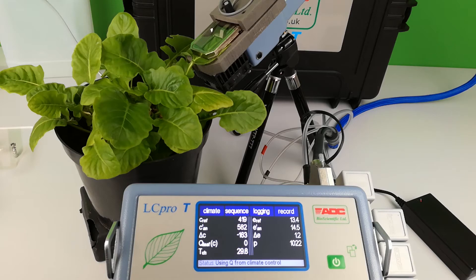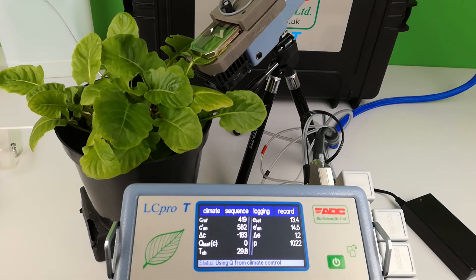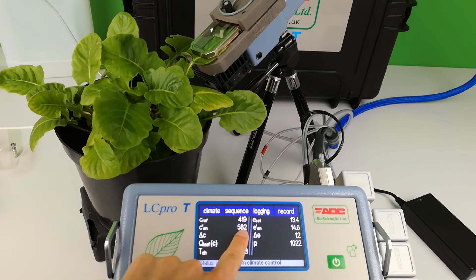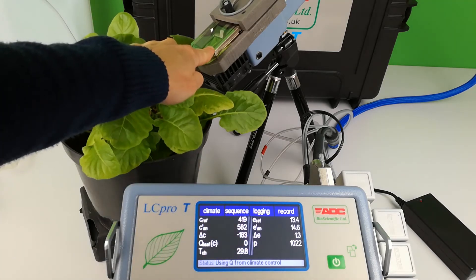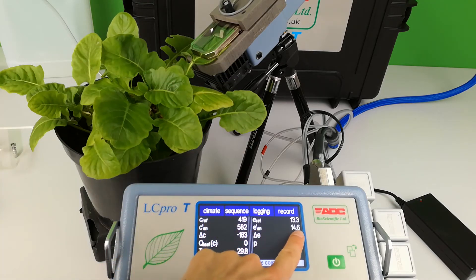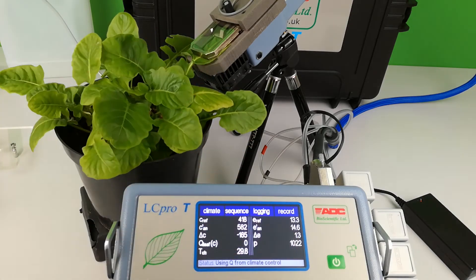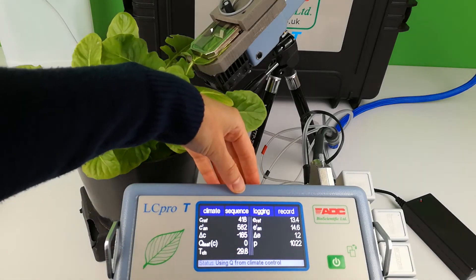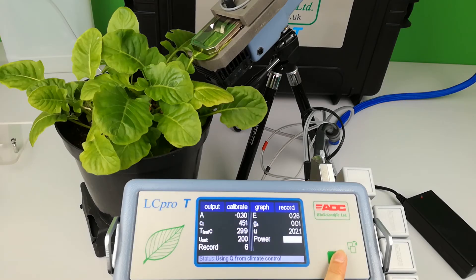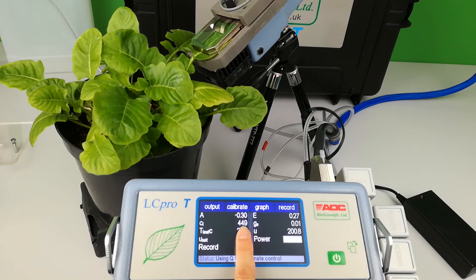A leaf once enclosed in the chamber may take 2 minutes or less to readjust to the new microclimate. The CO2 analysis or C-AN value is the concentration of CO2 within the leaf chamber. Similarly, E-AN or E-analysis is the water vapour concentration within the chamber. On main menu 2, watch for C-I to stabilise. This is a good indicator of leaf adjustment.